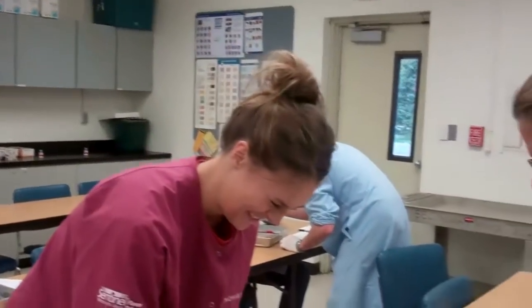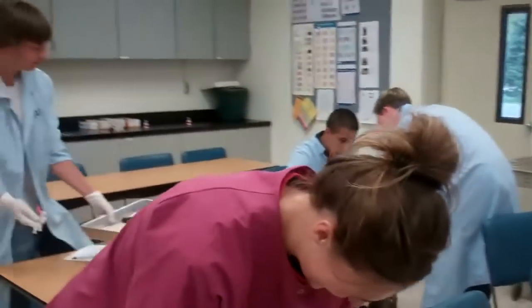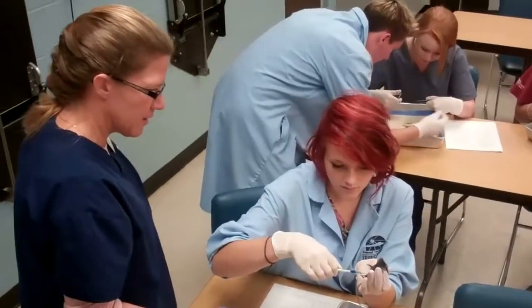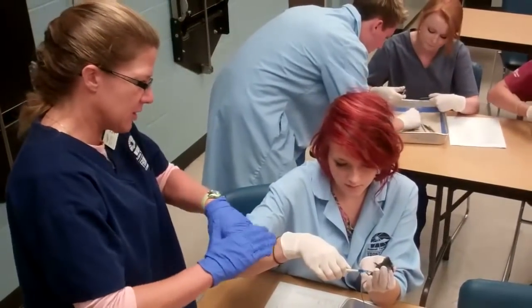Good job. I love how she finished her little video with a little smile to capture the light. So we're going to get more at an angle, because we want to get right underneath that skin. So we're getting right underneath the skin layers.